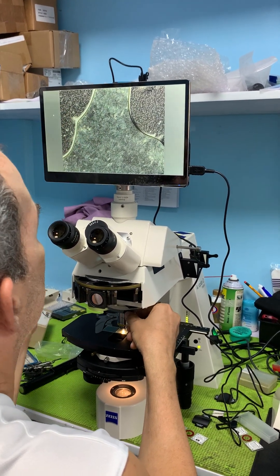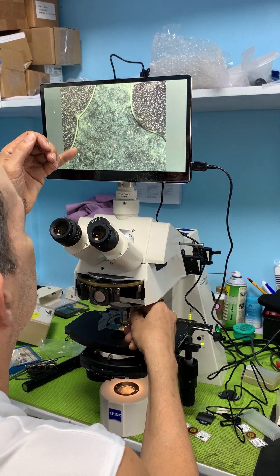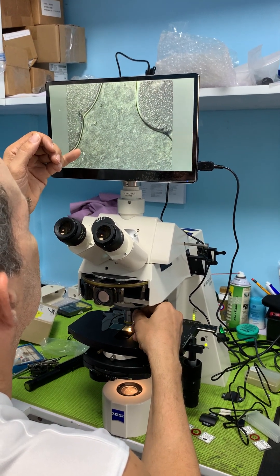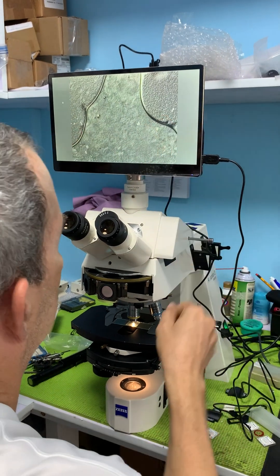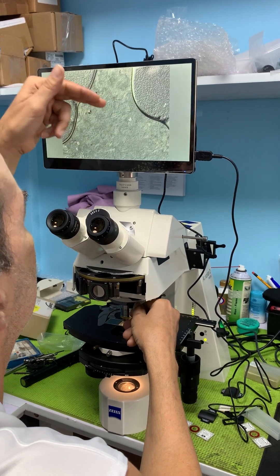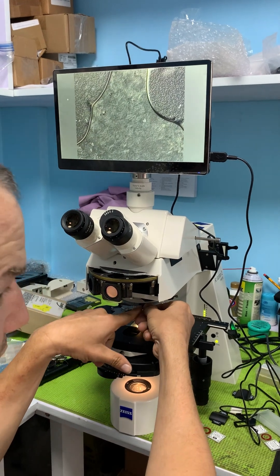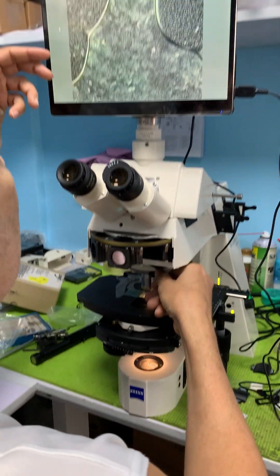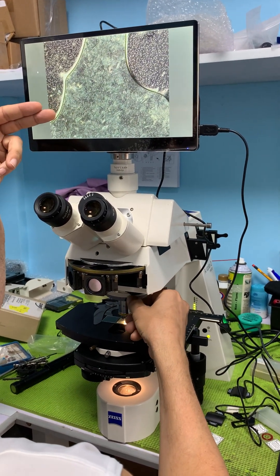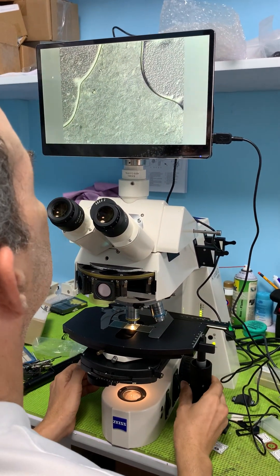I'm going to rotate it the full way — we'll go through the pseudo dark field and then to the negative bias on the other side, where the cells look like they're cratering in, pitted like craters on the moon. Then turning again, they start coming out at me like a volcano — there's the pseudo dark field setting and now they're sticking out.